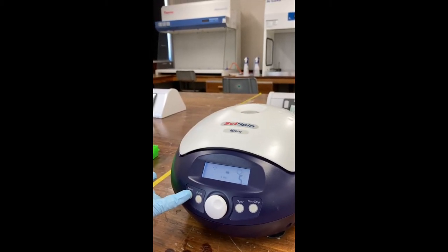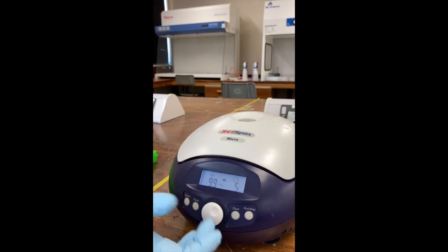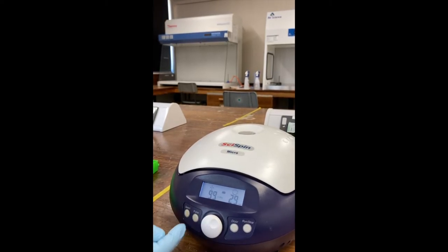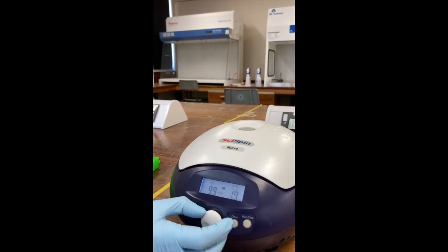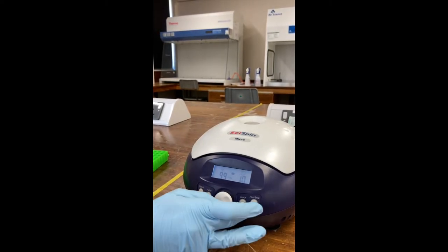The next thing you can change is the time in minutes. We'll set it to 10 for an example. You use the dial there to just change the setting that you want. And then when you're ready, press run.